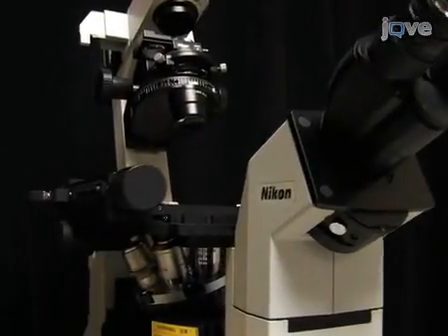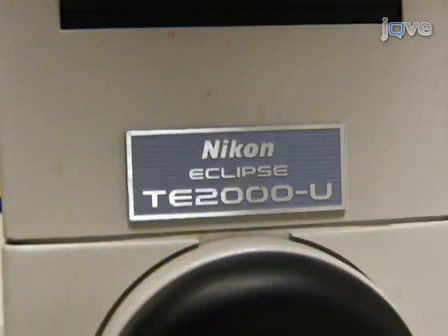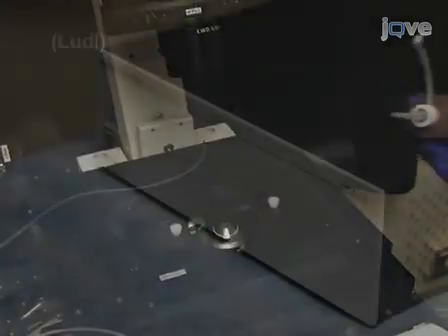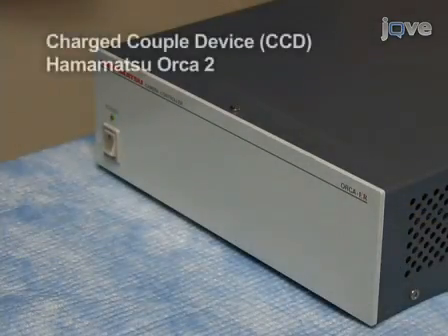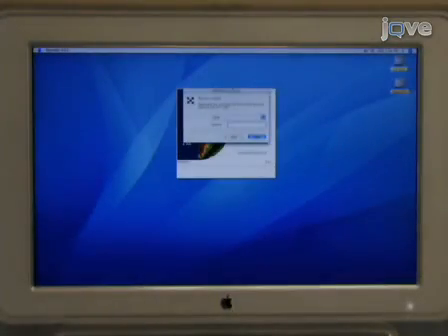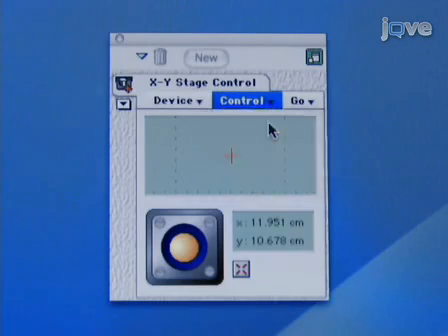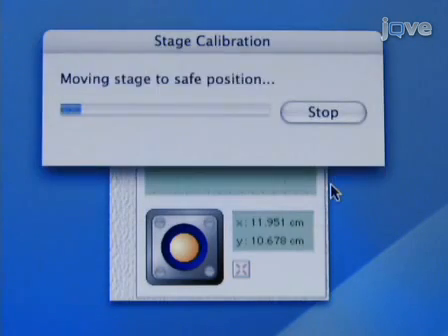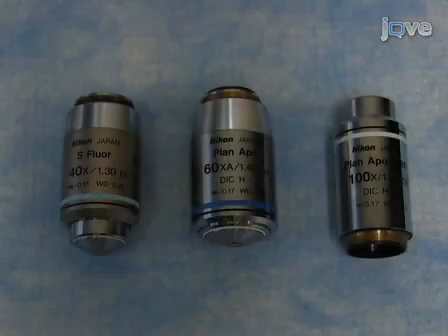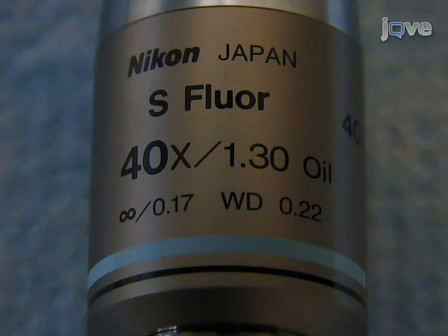For calcium imaging of cells, we use an inverted Nikon Eclipse TE-2000U microscope equipped with a xenon arc lamp from Sutter Instruments, an automated stage, and a cooled charge-coupled device CCD camera, the Hamamatsu Orca 2. The microscope is controlled by a Macintosh computer running OpenLab software by ImproVision. To begin imaging, calibrate the automated microscope stage to ensure that the appropriate coordinates are found. Then place a drop of oil on the objective. For imaging, we use 40, 60, or 100 times Nikon fluorite oil immersion objectives with an NA exceeding 1.2.